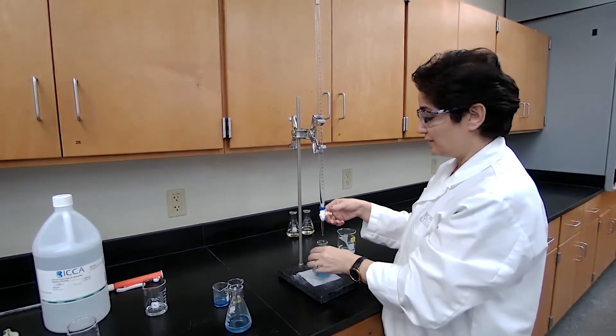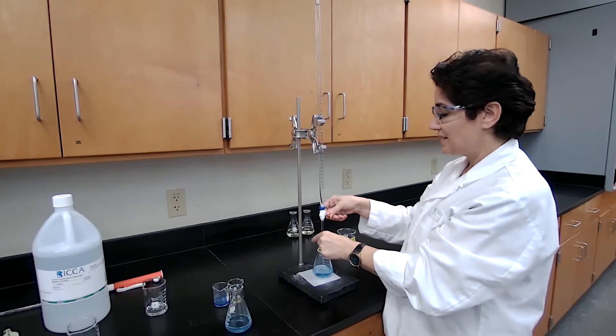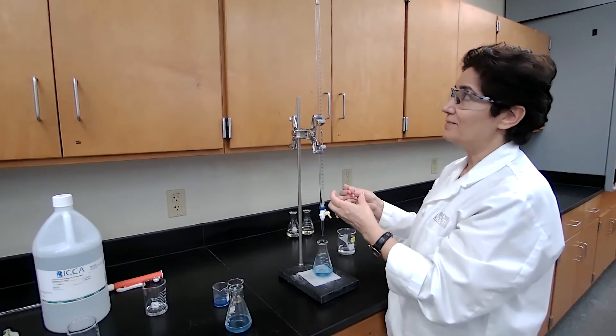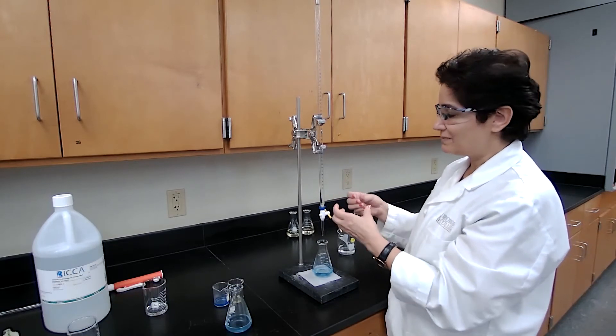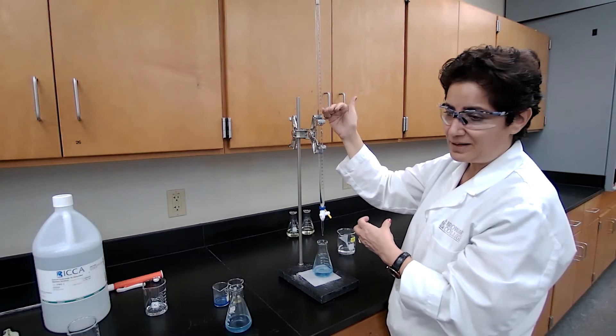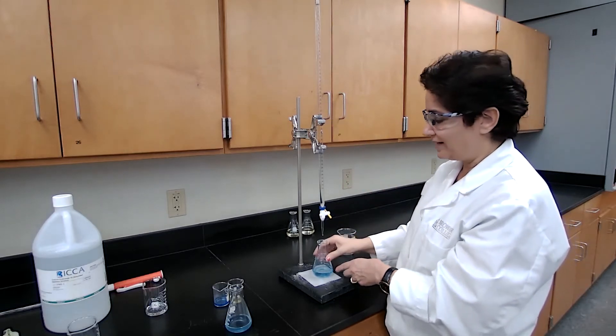Bromothymol blue, same indicator is used for the titration. I expect is the first time that we are doing the experiment, but I do expect that this time I'm going to use less than 27 milliliter because of the common ion effect.